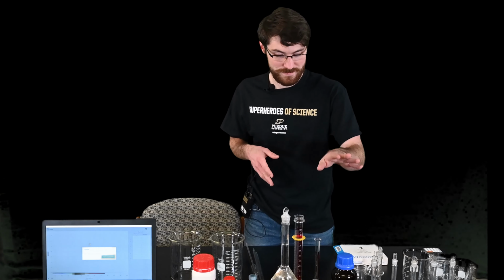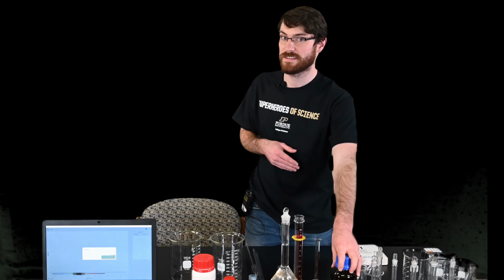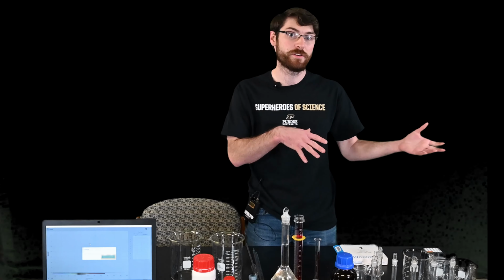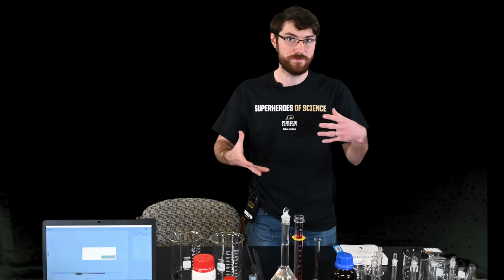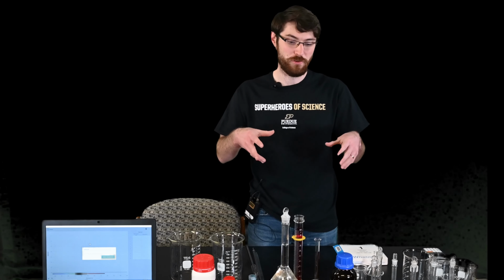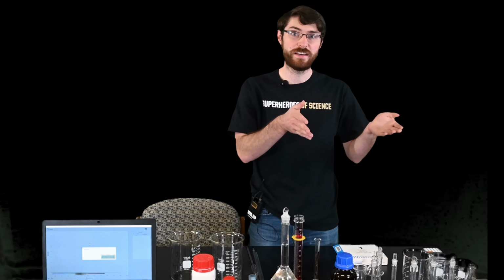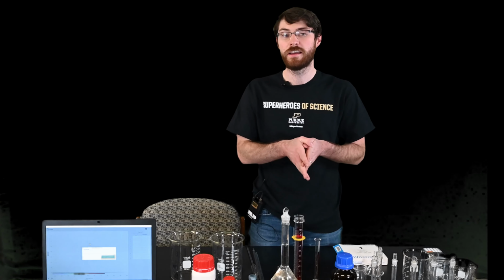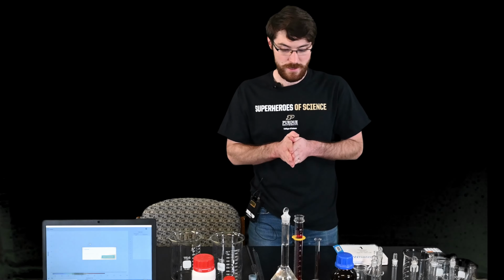So of course, we have several materials. We need a river water sample. It's best if this is collected as close to the experiment as possible, and also in an area with low turbulence. So you don't want a whole bunch of precipitant, you don't want a whole bunch of solids in your water sample. And it should be stored ideally in a dark brown container, also refrigerated if you have to store it for a few days.